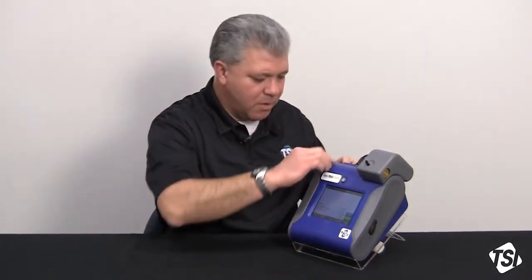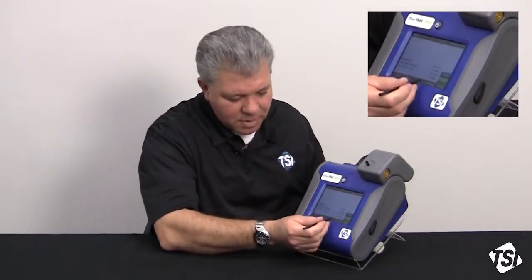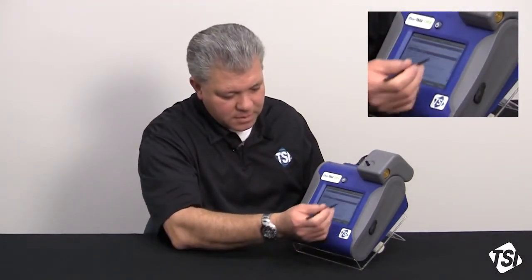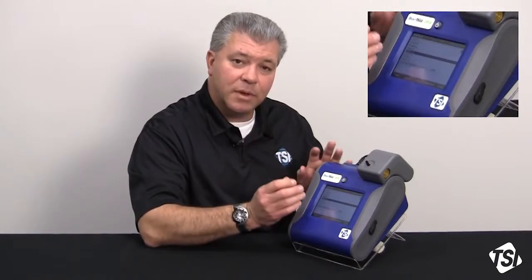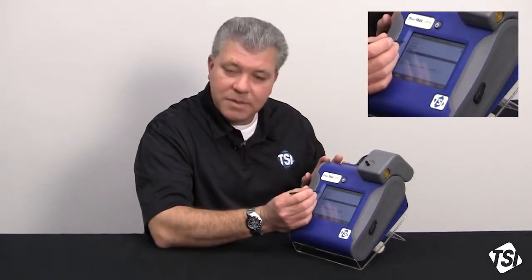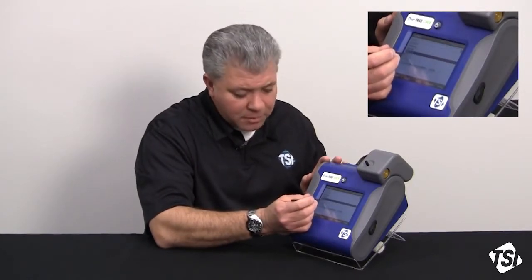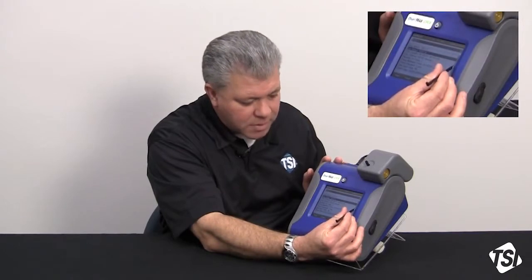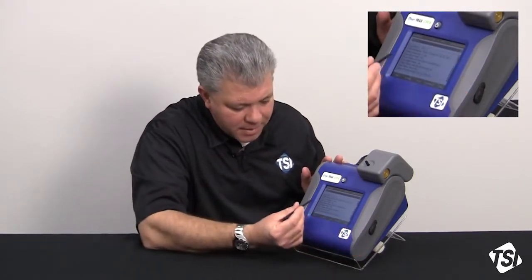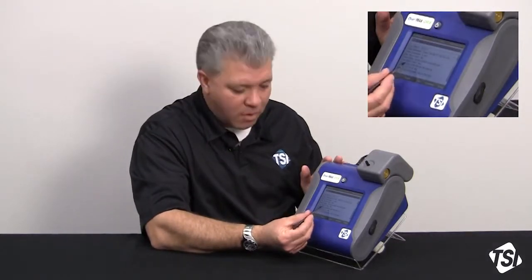Now what we do is we go over to the setup menu, or excuse me, the run mode menu. Click on that and come up to a logged program. You set this through the logging programs, not the manual program, only the program log modes. So I'm going to select one of the program log modes and scroll down to the very bottom, where it says Auto Zero module on or off.